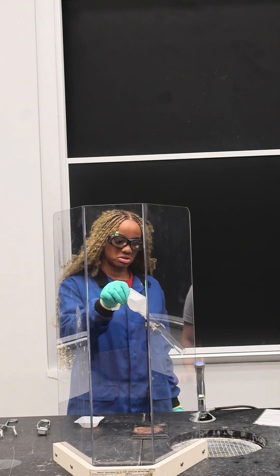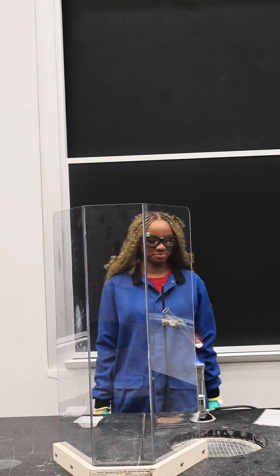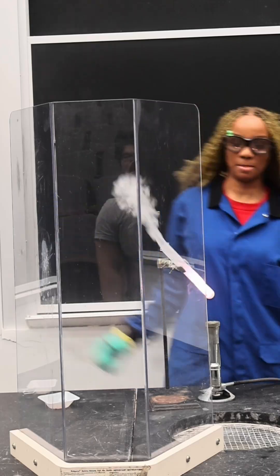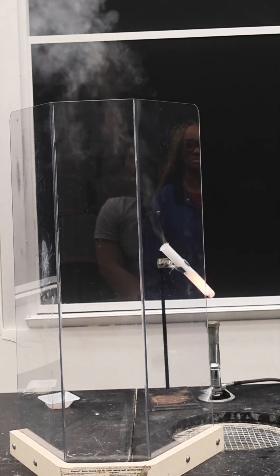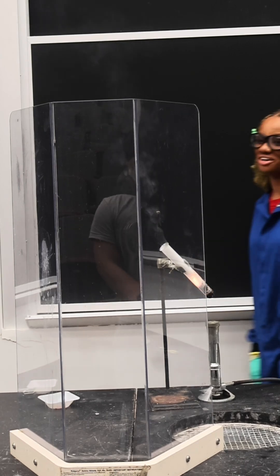In front of me I have a gummy bear and a test tube of potassium chlorate. When I heat the test tube and drop the gummy bear in, the sugar in the gummy bear reacts with the oxygen in the melted potassium chlorate in a combustion reaction, releasing carbon dioxide and steam.